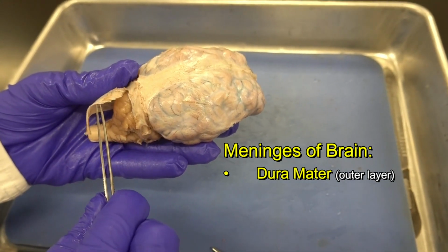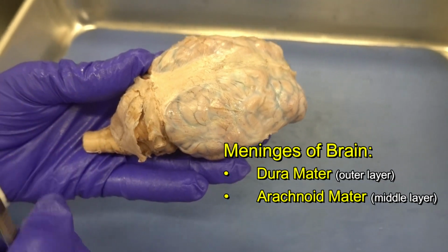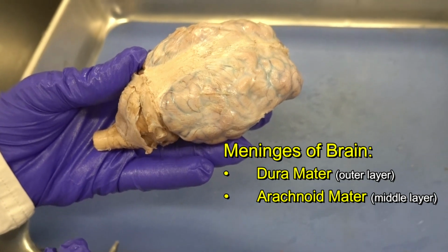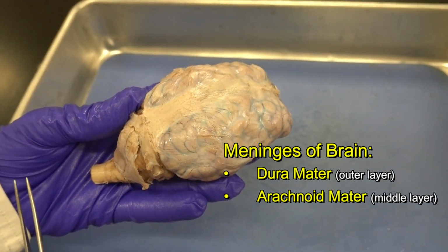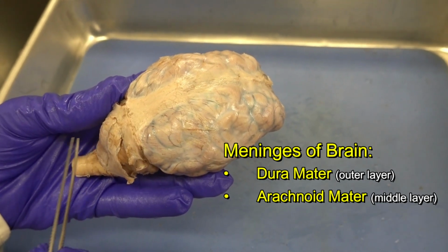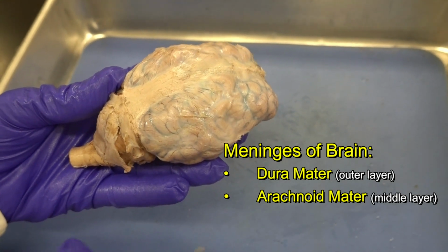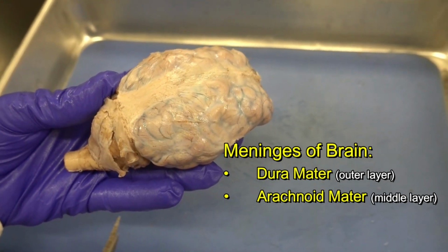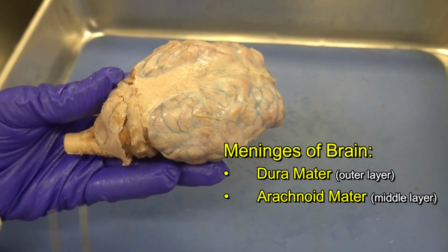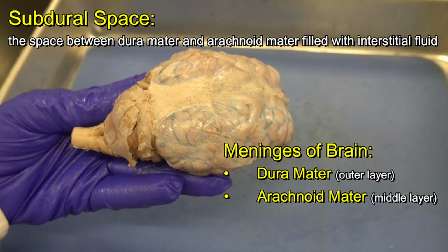The middle layer of the meningeal membrane is called arachnoid mater. Arachnoid mater is thin and it's avascular. It's composed of loose connective tissue. So that's one of the major differences: dura mater is dense, irregular connective tissue, but arachnoid mater is mostly loose connective tissue. It has some collagen and elastic fibers, and more importantly, it's avascular. Between dura mater and arachnoid mater, we have a space that is called the subdural space. That space is filled with interstitial fluid.